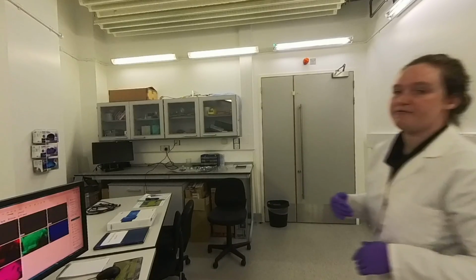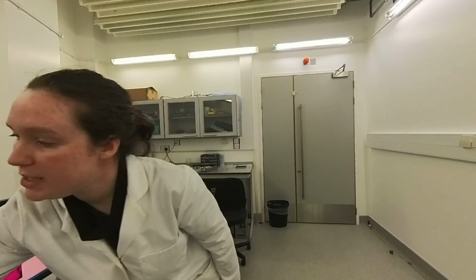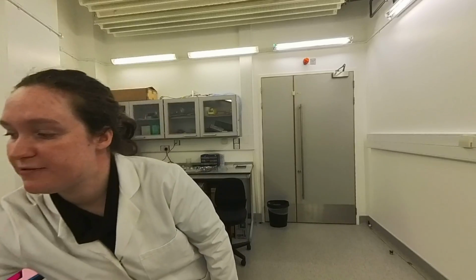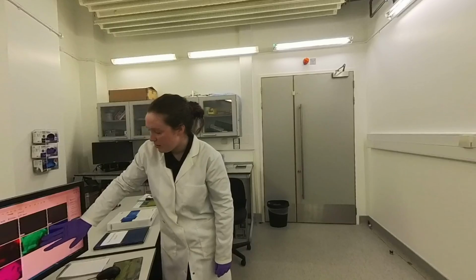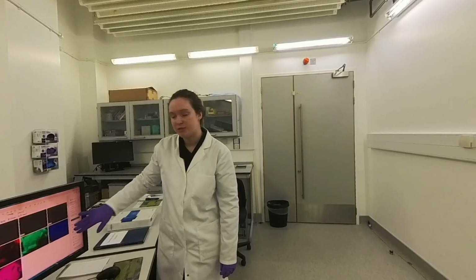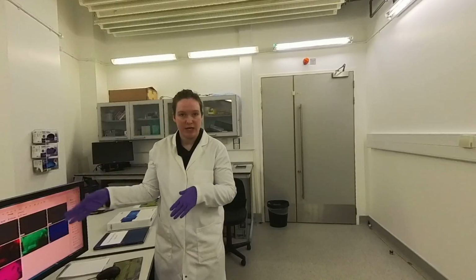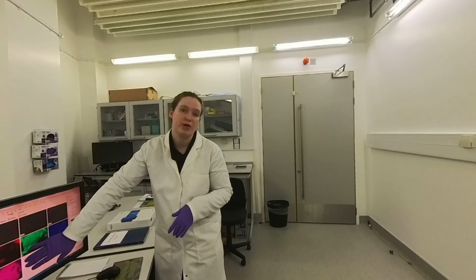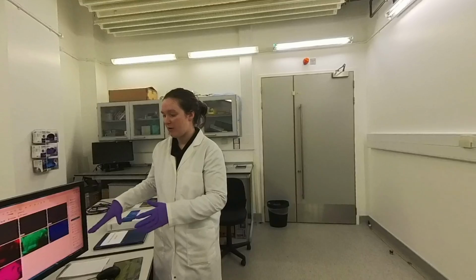Over here, we have an example of an image collected by our electrons. So this is a nanoscale image of our sample, and the electrons were collected from the different areas, giving these different contrasts of black and white features. And over here, we have different X-ray maps where different energies of electrons are collected, which we can use to determine what elements are present in our sample in different areas.